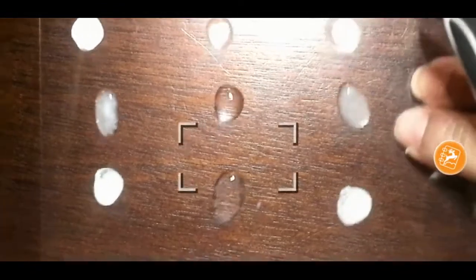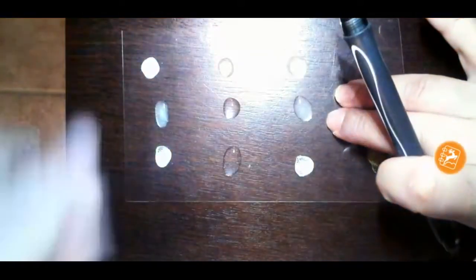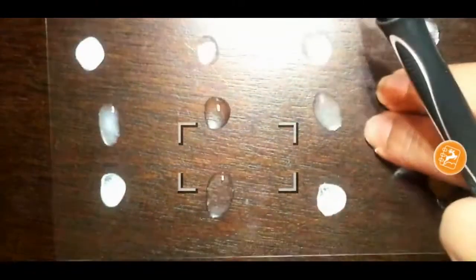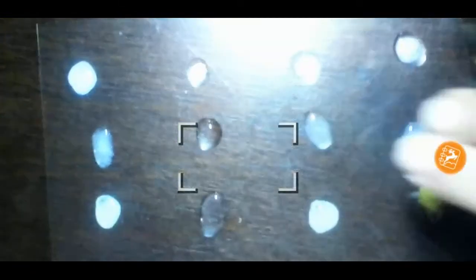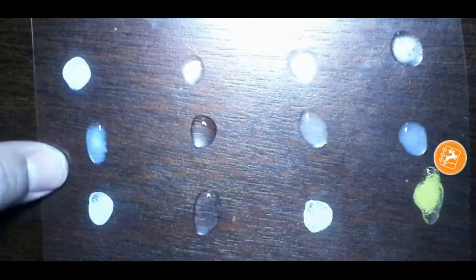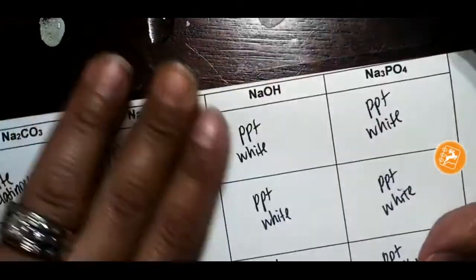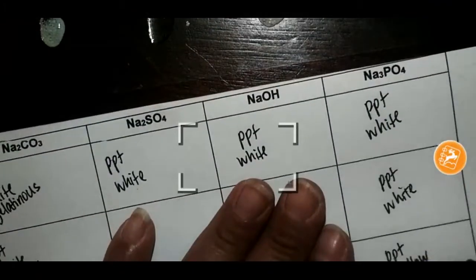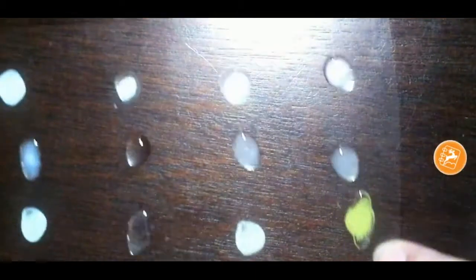You can go ahead and give a third descriptive term for these three. If you need to see it again, I'm going to zoom in. And then now we're on the last column. So now we're looking at these three. And I want you to go ahead and add a third term.